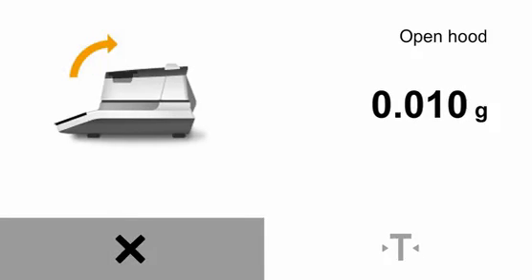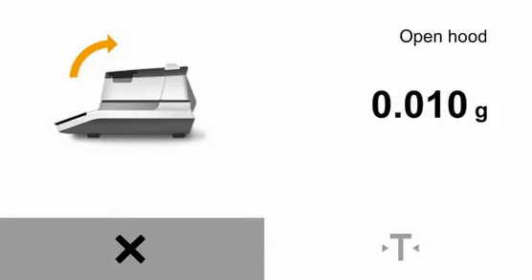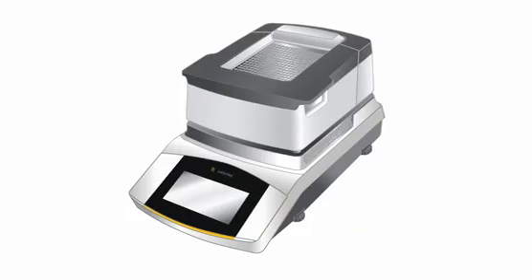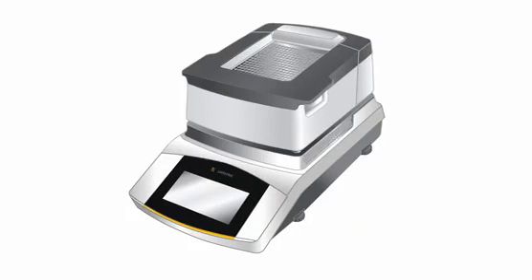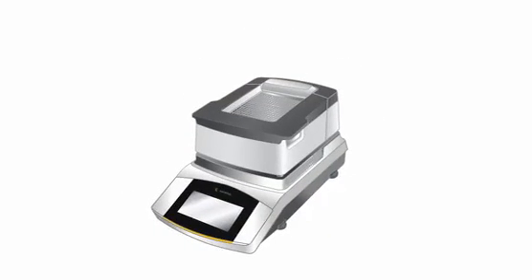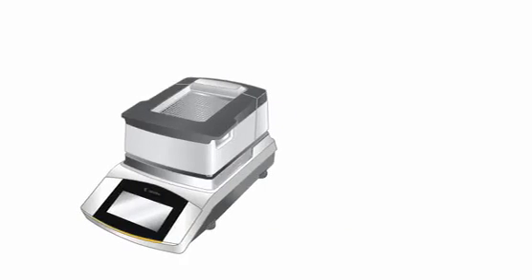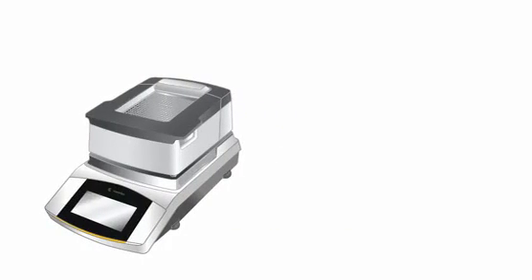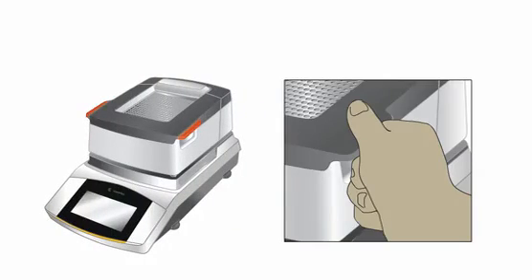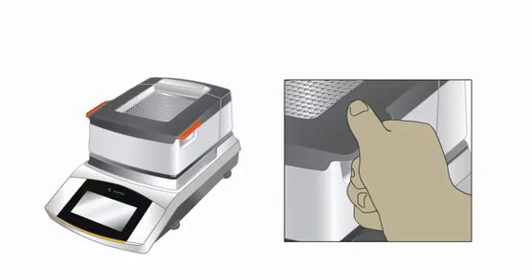Open the hood. Please use the handles on the upper side of the hood.